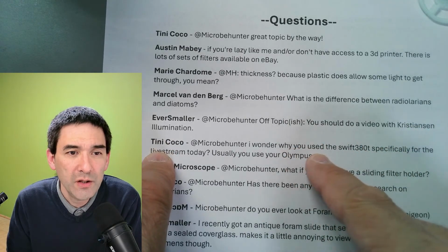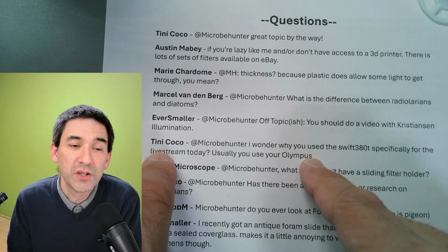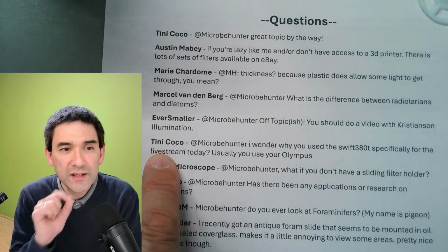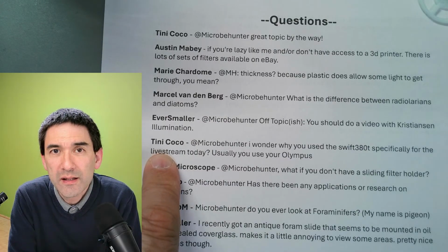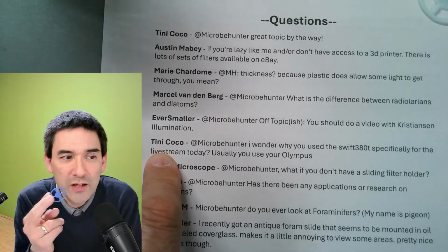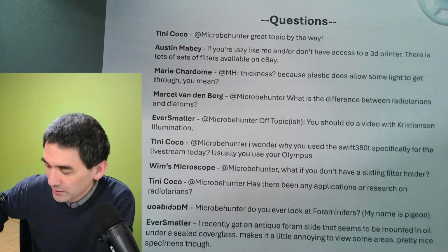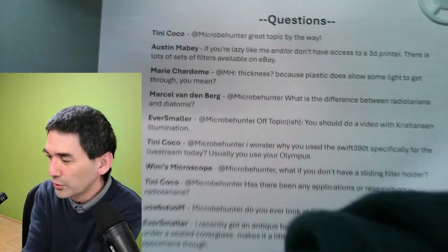I wonder why you use the Swift 380T specifically for the live stream today. Usually you use your Olympus. That's a good question. This is correct. As a matter of fact, I actually had to. The reason is the following: my Olympus microscope basically does not allow me to easily exchange those filters. You know what I'm going to do, I'm just going to switch off this microscope here, and I can actually show you.